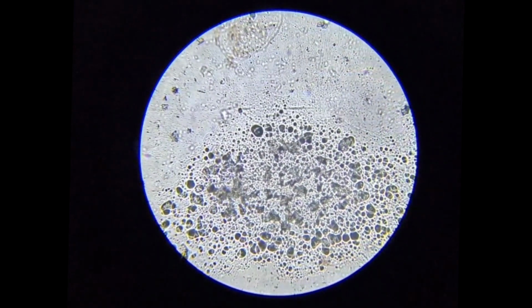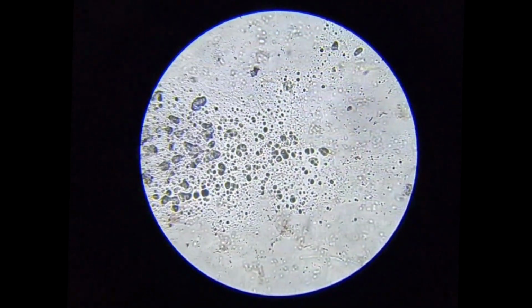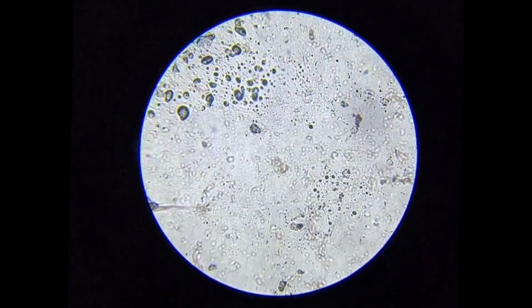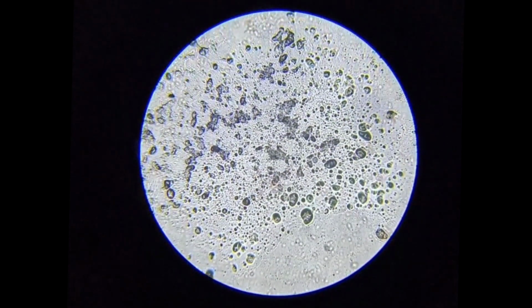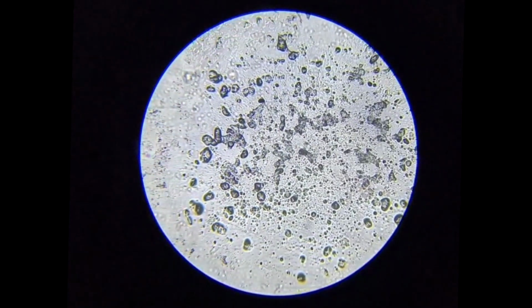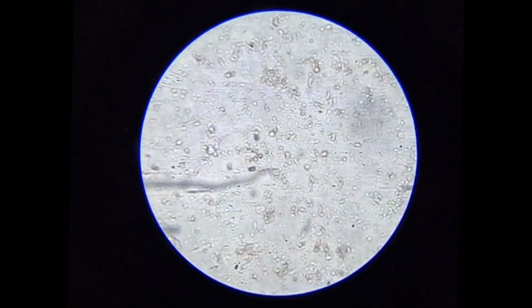The large circular shapes visible in some areas may be intact cells, partially collapsed cells, or even small air bubbles trapped under the cover slip. Because this is a sap smear and not a structured peel preparation, the pattern remains similar across the entire field of view: dispersed pigment bodies floating within the liquid matrix. This gives us a microscopic look at the internal pigment system of the tomato rather than its organized cellular structure.